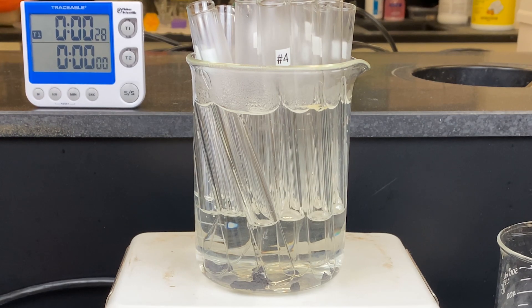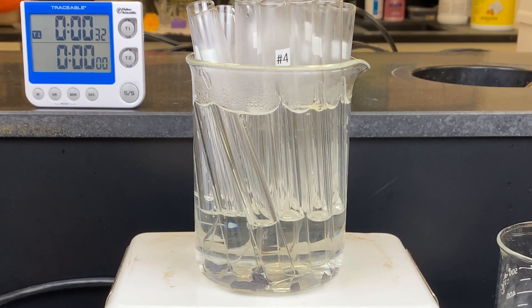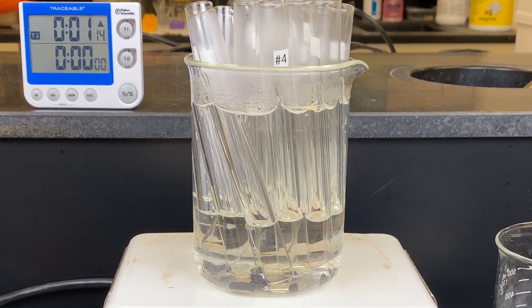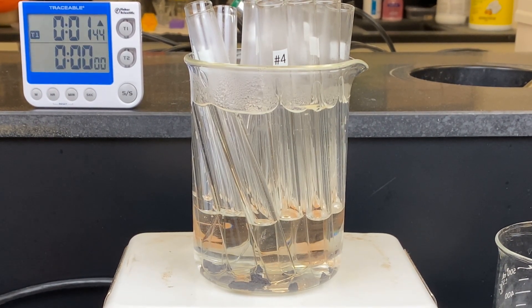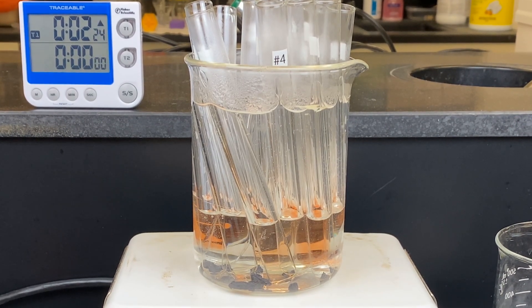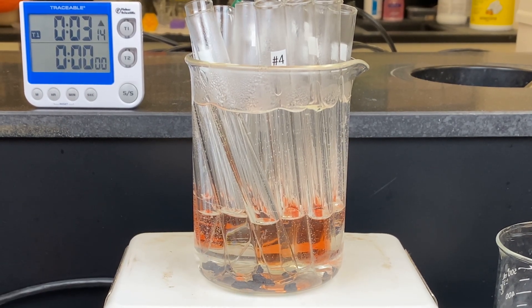So we're not sitting here watching it for five minutes, I will speed it up to ten times normal speed. You can start to see the reaction happening. The tubes appear to be turning a peach color, and as it progresses, any ketoses will turn a cherry red color.